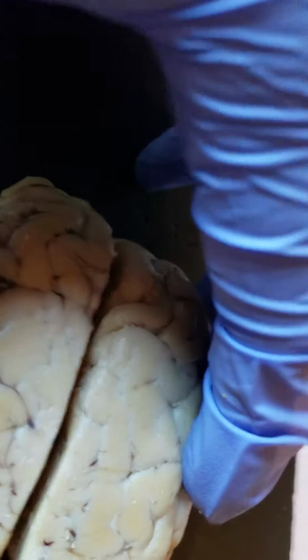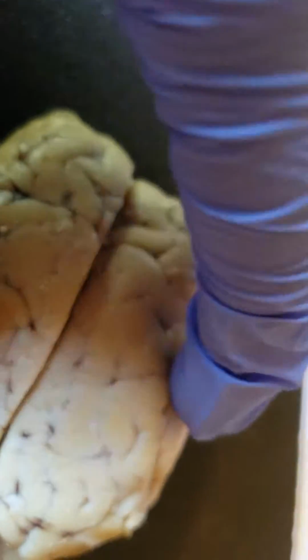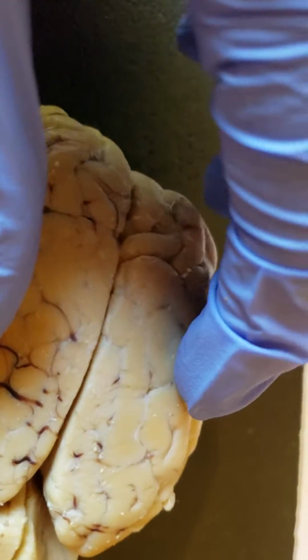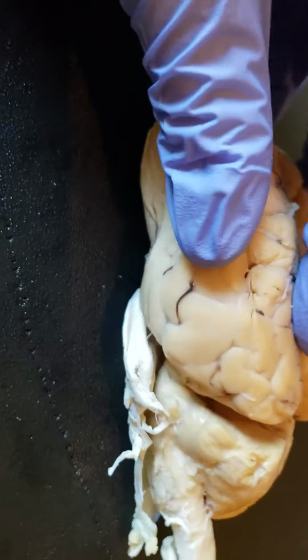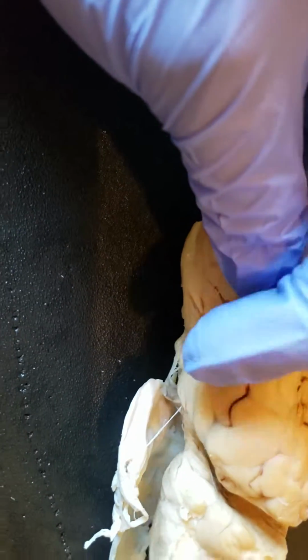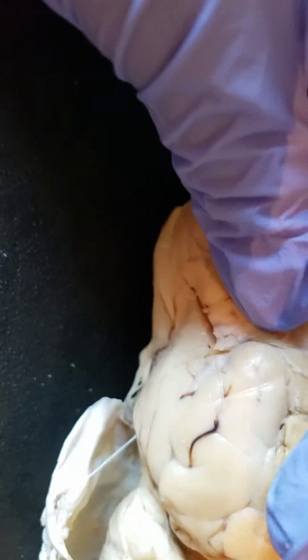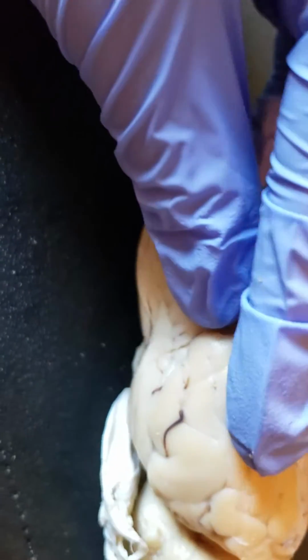Longitudinal fissure, that is this big long one that runs right down the middle of the brain. Normally these two hemispheres are connected, obviously. However, I bisected the brain, and so now the longitudinal fissure is just an opening, but normally it just looks like that. And then you have the lateral fissure, which separates the temporal lobe from the frontal and the parietal, and that's going to be this thing that I'm trying to pull apart right here. So like frontal over here, temporal where this finger is, and then it continues all the way up there.